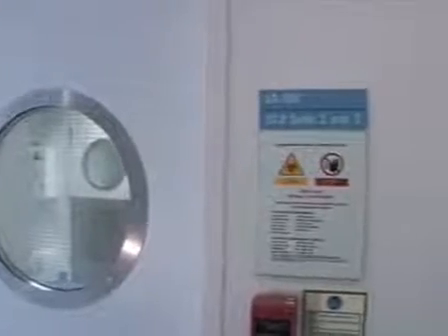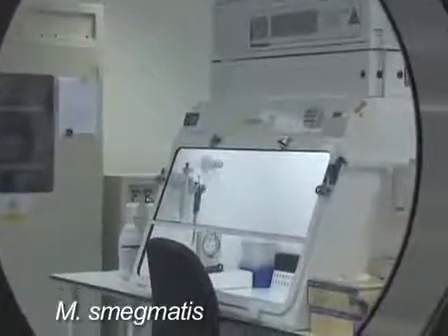In our lab we study Mycobacterium tuberculosis, but because it is highly pathogenic and requires CL3 containment facilities, we will show you this technique in the non-pathogenic Mycobacterium, M. smegmatis. So let's electroporate some bacteria.